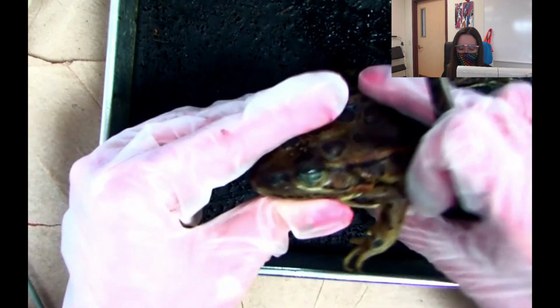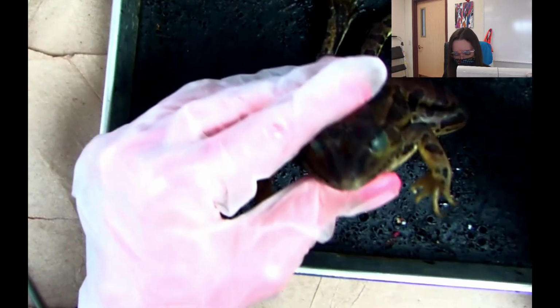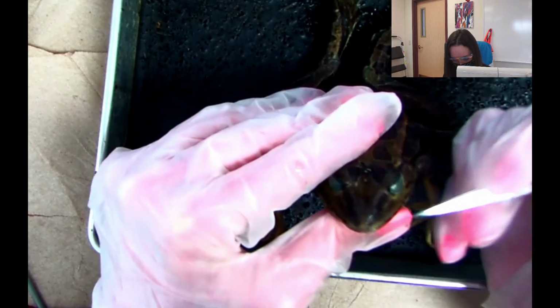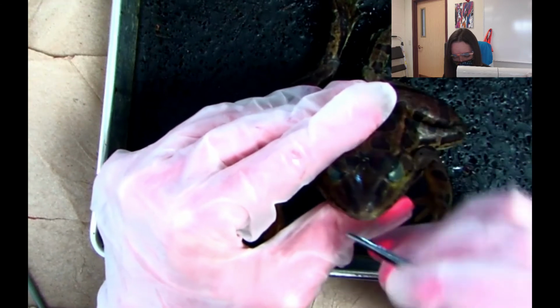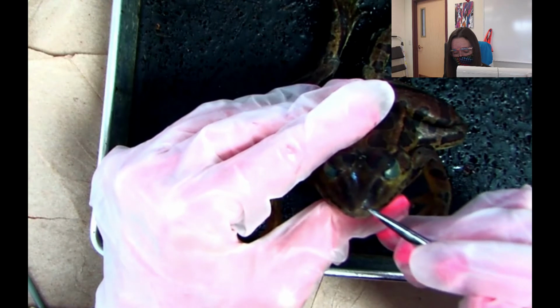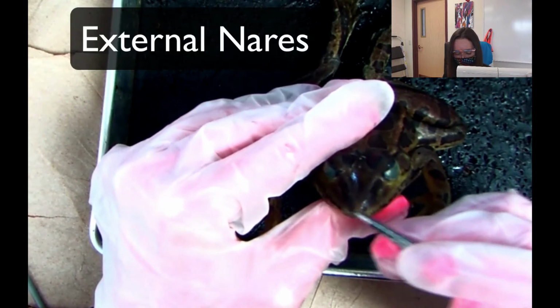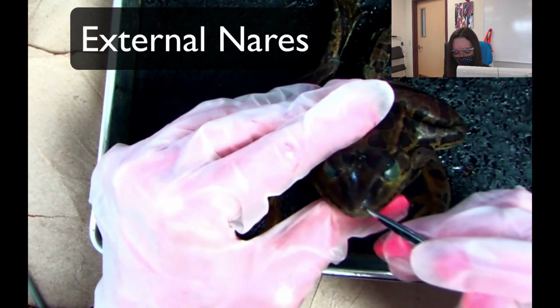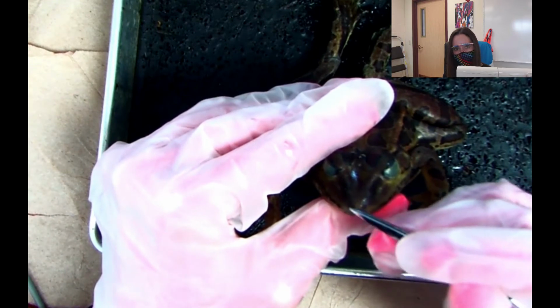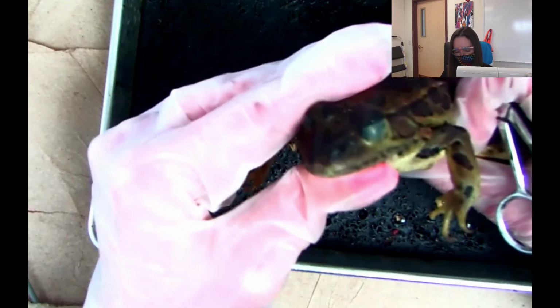Okay, the next part that I'm going to go over is actually kind of hard to see in general, even in person. If you were to look at it, I'm actually having a difficult time. But there are these 2 holes at the nose area, and you would think, oh, it's the nose, right? Well, we call it the external nares. So you'll see these little 2 holes, and they're called the external nares. On the quiz, we could say the 2 holes right here. And so those are the external nares, which makes a lot of sense, hopefully.